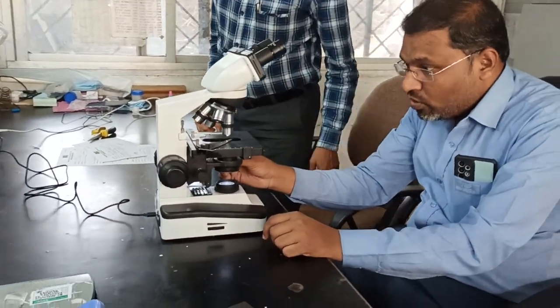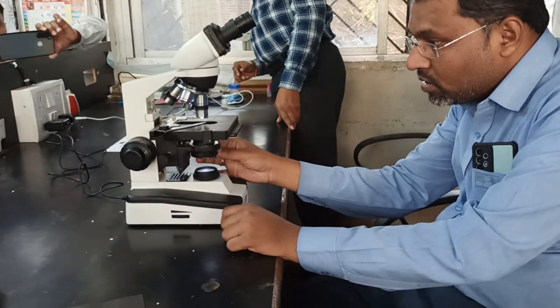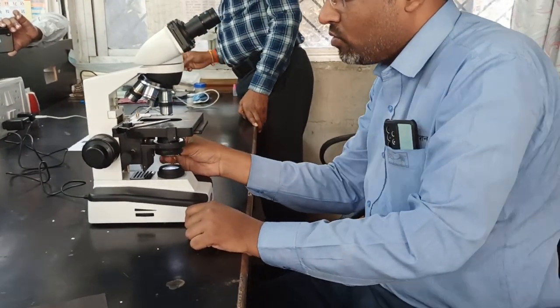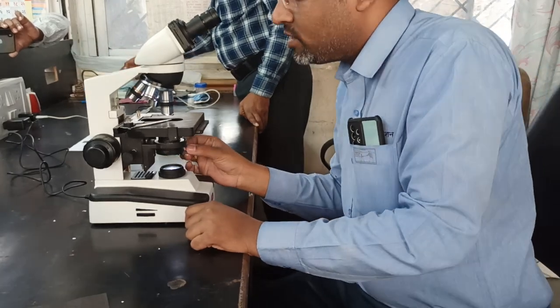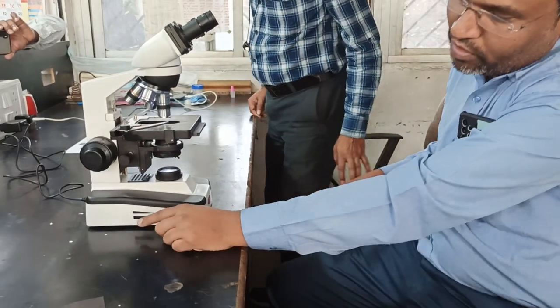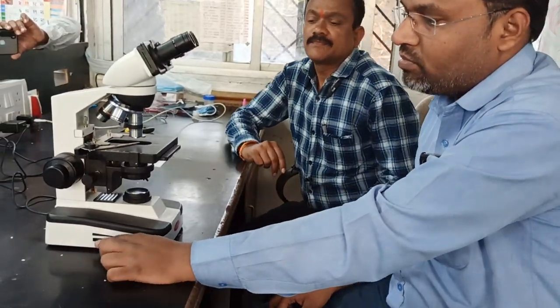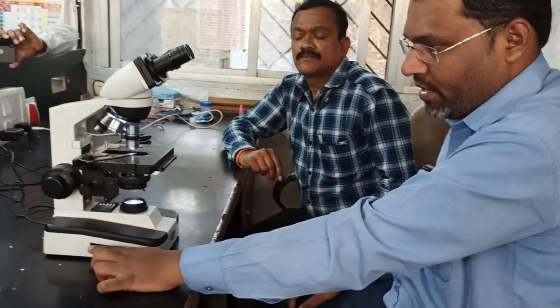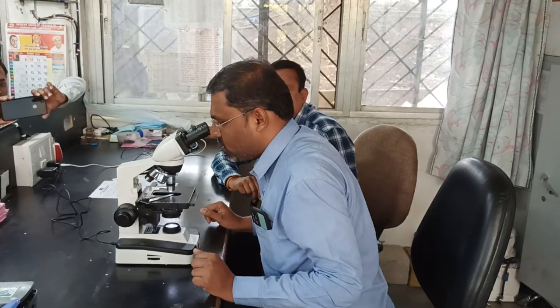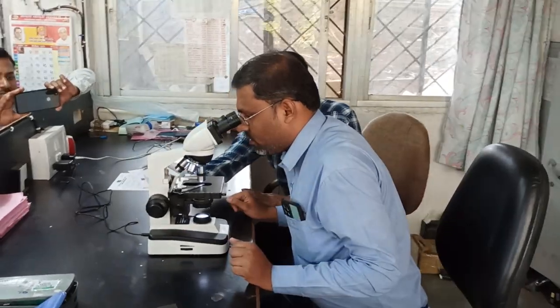So already I told you the use of this adjustment of the condenser. You can increase or decrease the view, right? And this is one more knob for the adjustment of intensity. You can decrease the intensity of the light and you can increase it. Whatever you want to observe, you just place here, and with the help of the eyepiece you can observe and study the things, right?